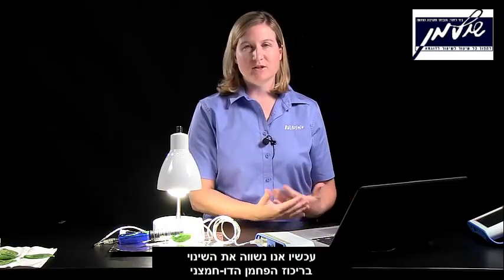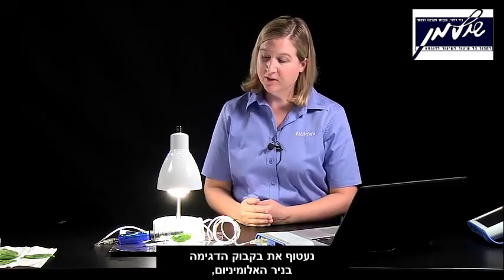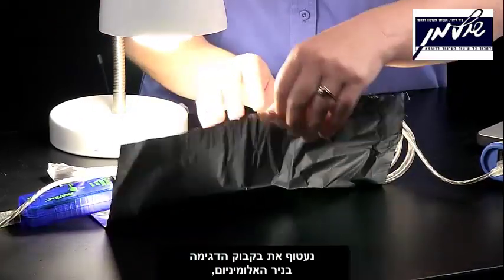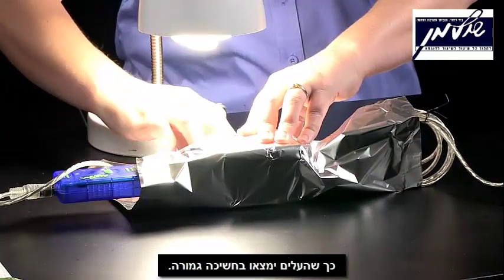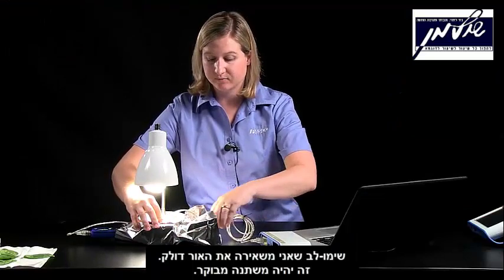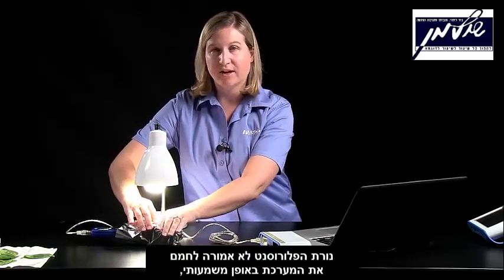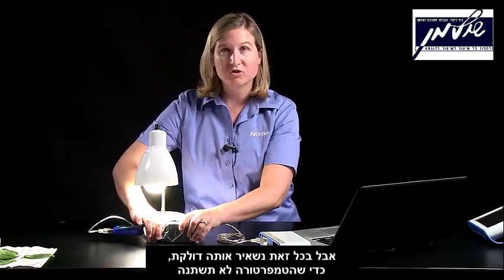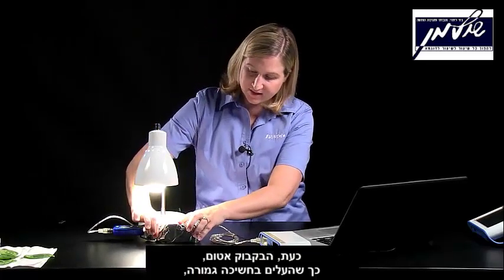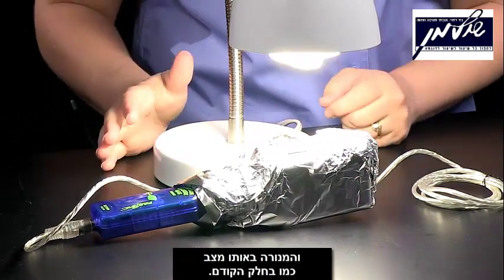Now we're going to compare the change in carbon dioxide concentration due to photosynthesis in bright light to what occurs when the plant is in darkness. The aluminum foil will fold over the sampling bottle so that the leaves will be in complete darkness. You'll notice that I'm going to leave the light on — this will be a controlled variable. The compact fluorescent light should not provide too much heat to the system, but we'll leave it on just to control for temperature between the two parts of the investigation.